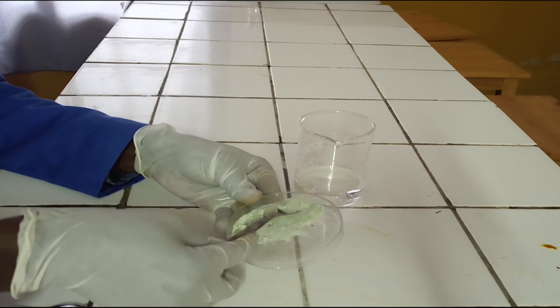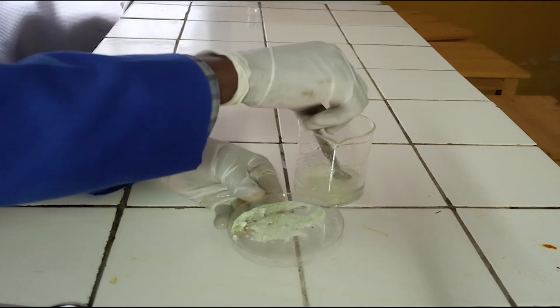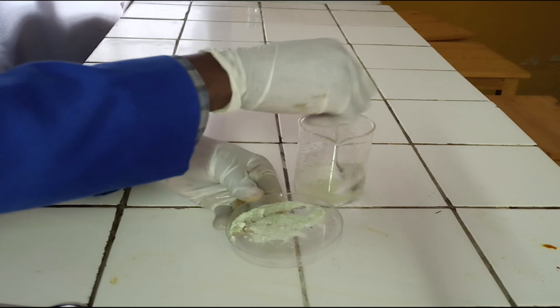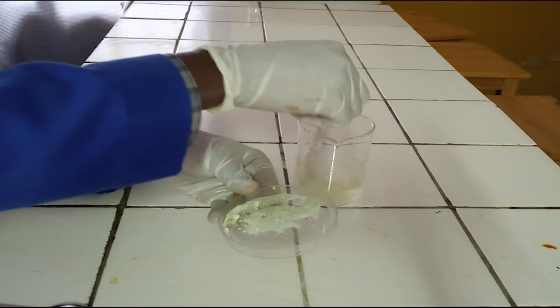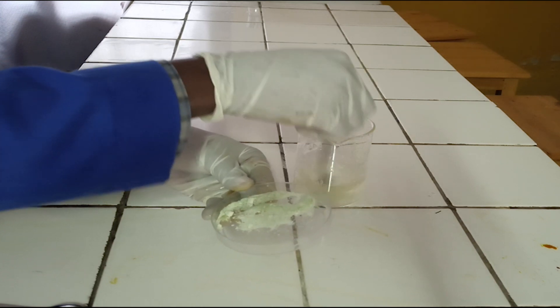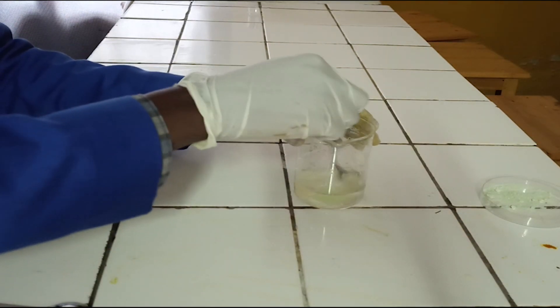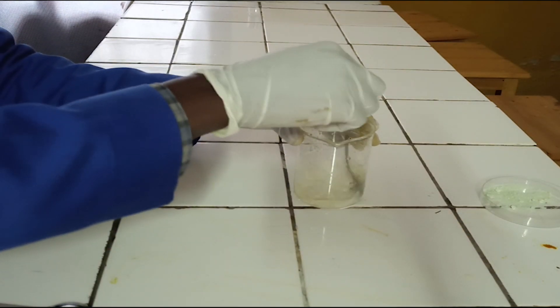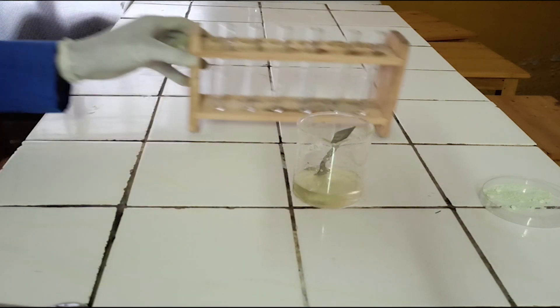Second step: dissolve a full spatula of salt in 50 milliliters of water. When salts of iron(II) ion dissolve in water, they form a green solution.